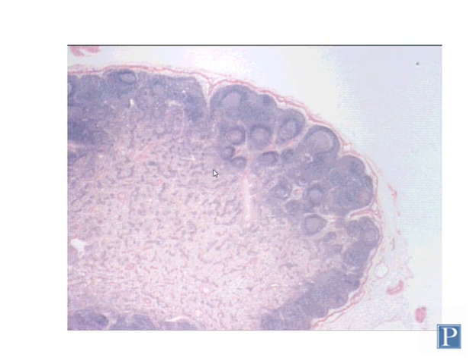Right now we're going to look at some specialized lymphoid organs. This structure here is called a lymph node, not a lymphoid nodule, but a lymph node. A lymph node is an organ that is surrounded by a connective tissue capsule, which is this eosinophilic structure that you can see right here.